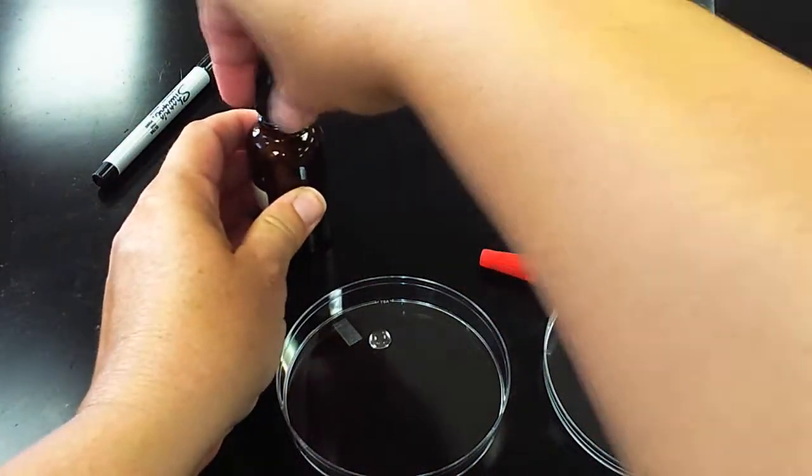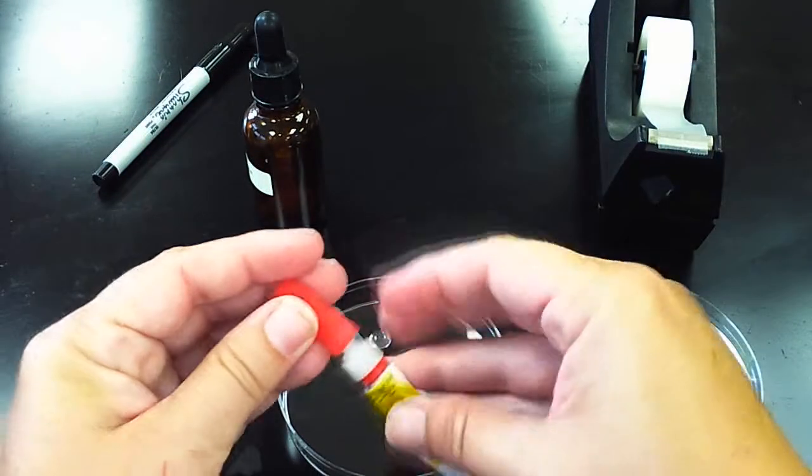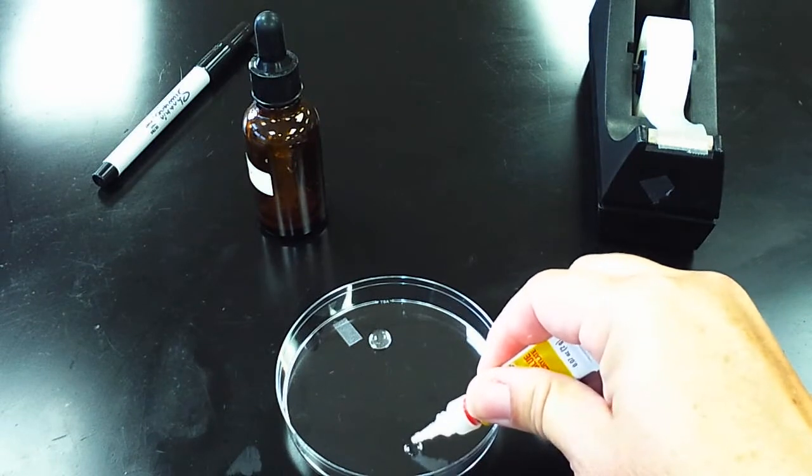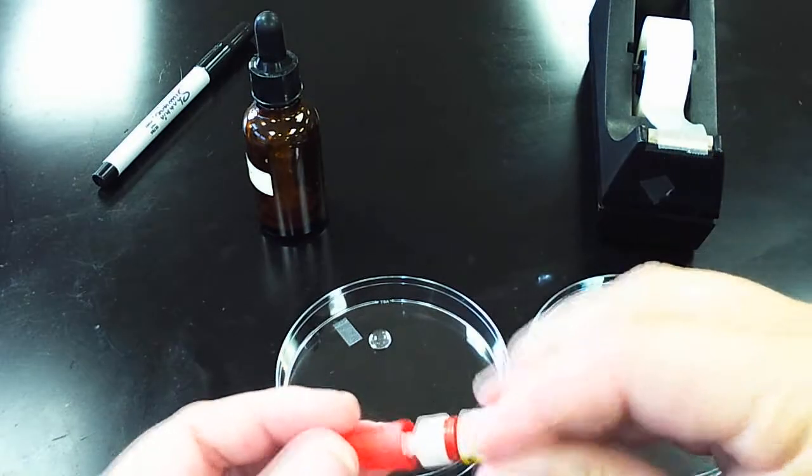And then on the other side you are going to place two drops of super glue. They don't have to be big drops, just enough.